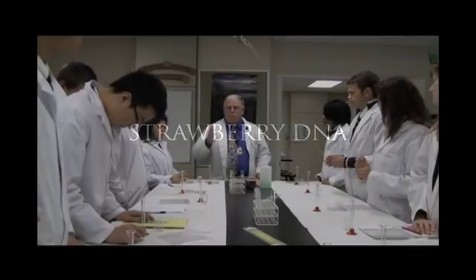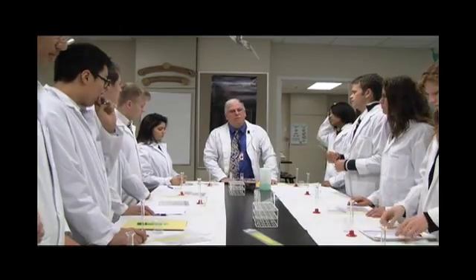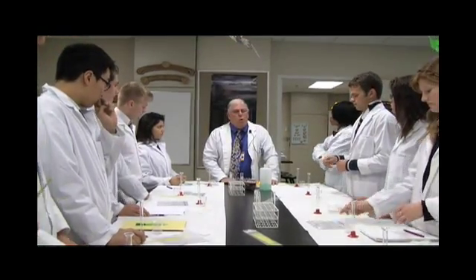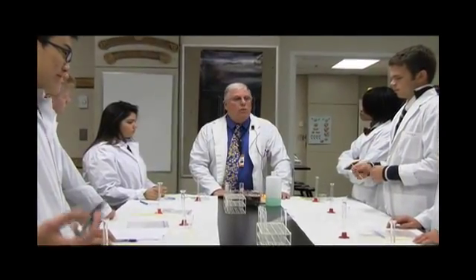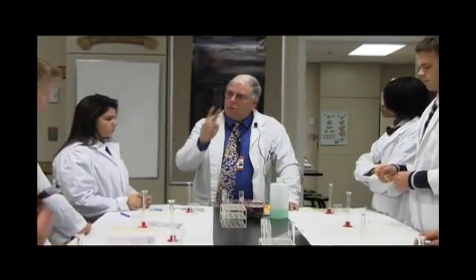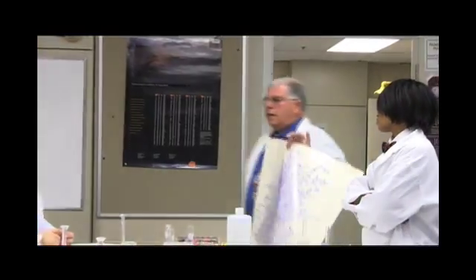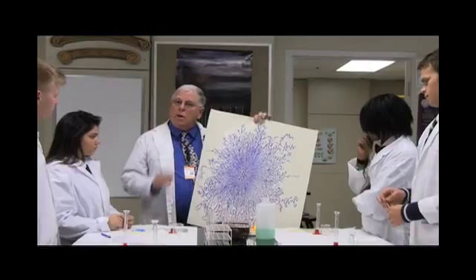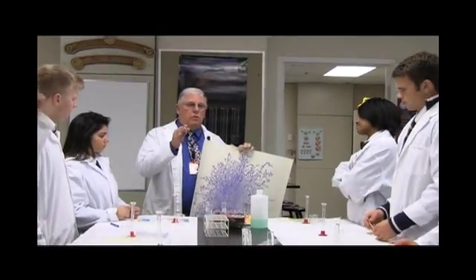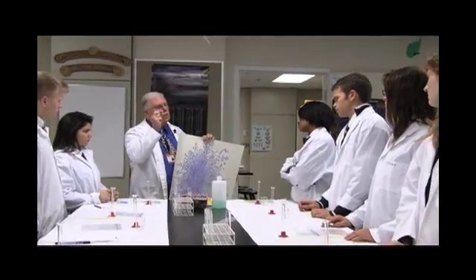First thing I want to impress upon you guys is that about 30, maybe 35 years ago, it took about a dozen PhD researchers about two weeks to isolate DNA from a bacterium like E.coli. This is the DNA of E.coli. So again, 12 PhD researchers, two weeks to extract a very minuscule amount of DNA.